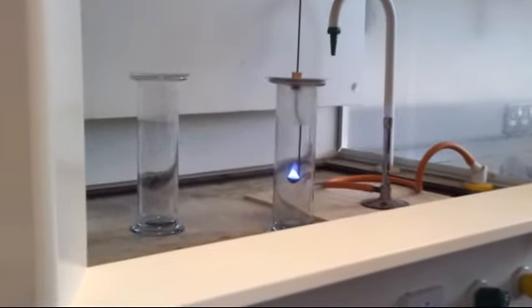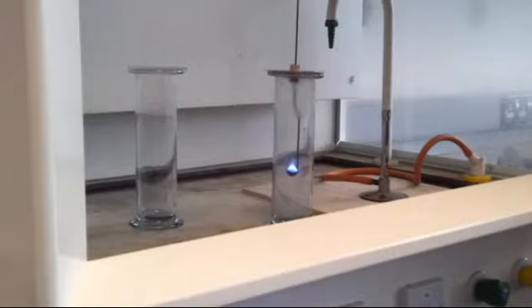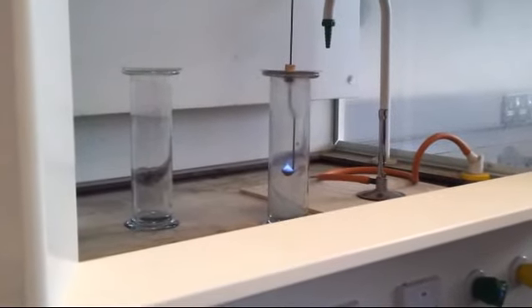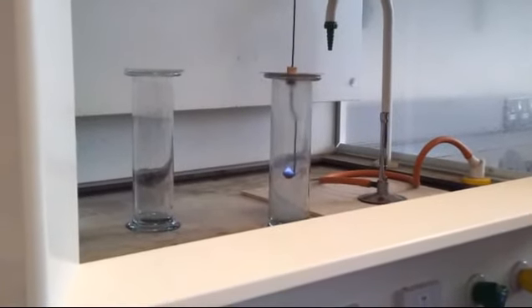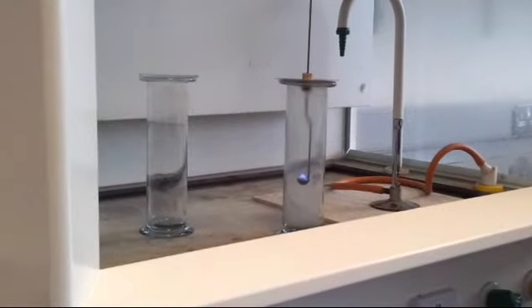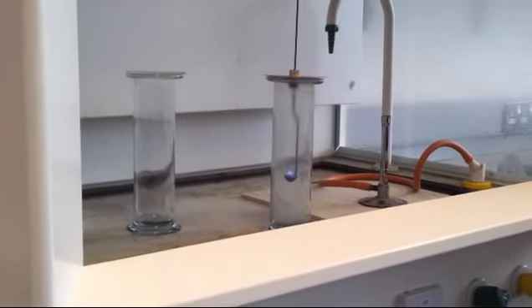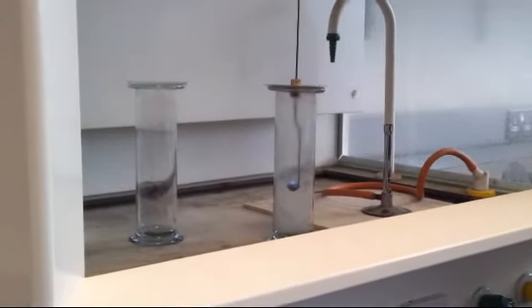So that's sulfur burning in oxygen. And it's a beautiful flame. And that's going to lead us on to the next step. Everyone know what you get when you burn sulfur in oxygen? S plus O2. Try and work it out. It's like C plus O2.